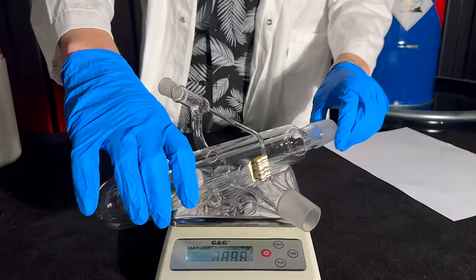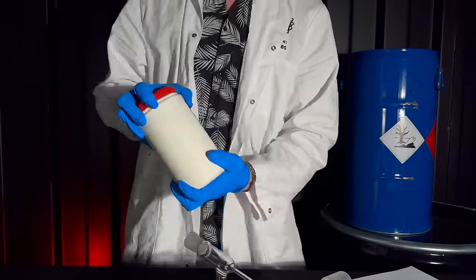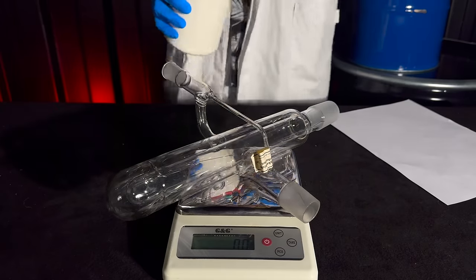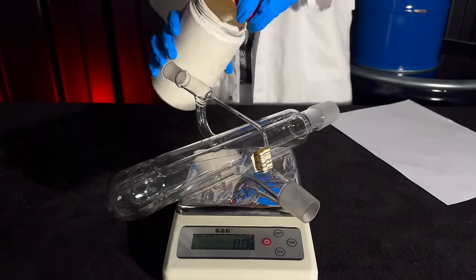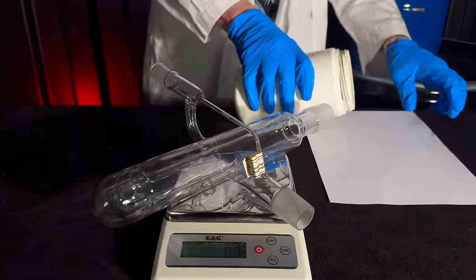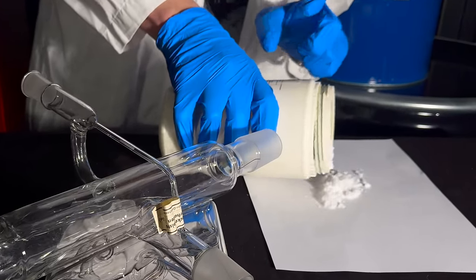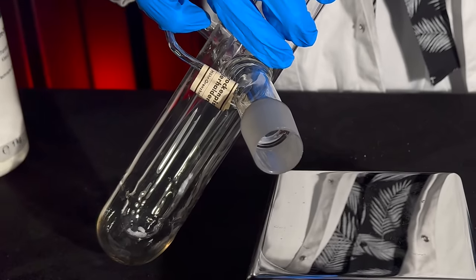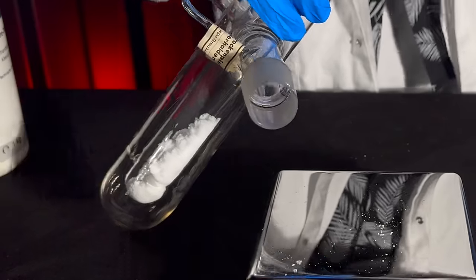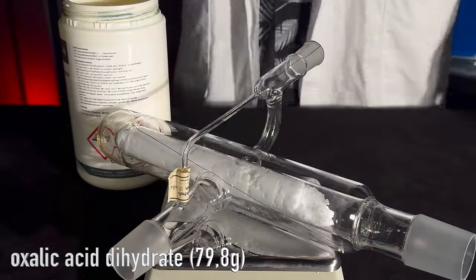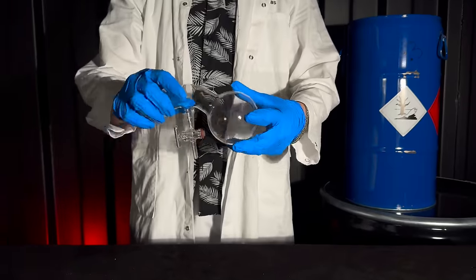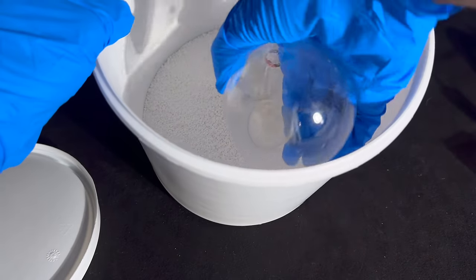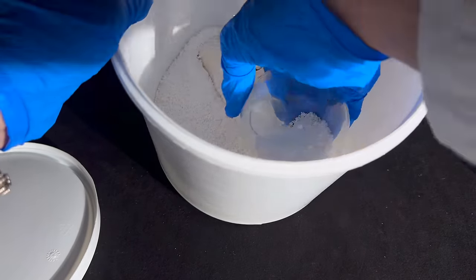This is the only step of today's synthesis that requires absolutely zero calculation. Having anhydrous oxalic acid around never hurts and therefore I've filled the drying pistol as much as possible. As it turns out I ended up filling the drying pistol with 79.8 grams of oxalic acid dihydrate. As a drying agent I use anhydrous calcium chloride as it is cheap and works well.